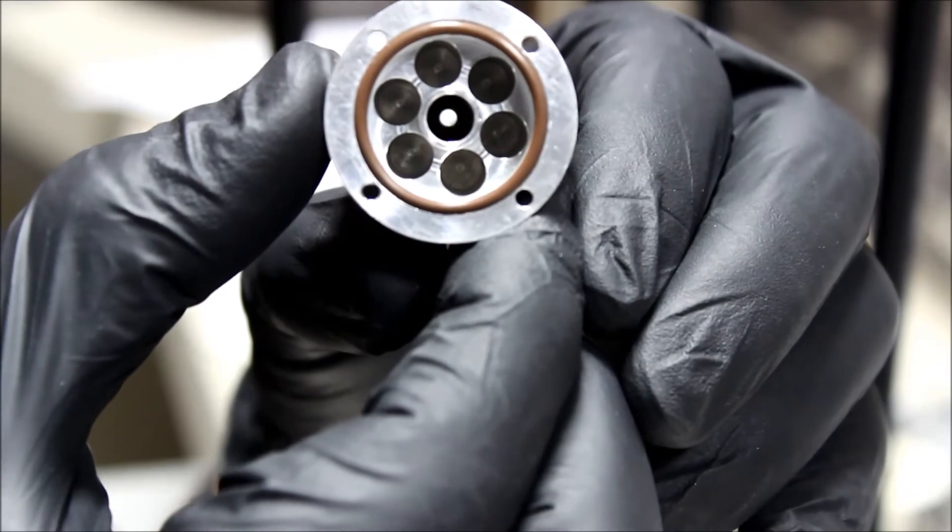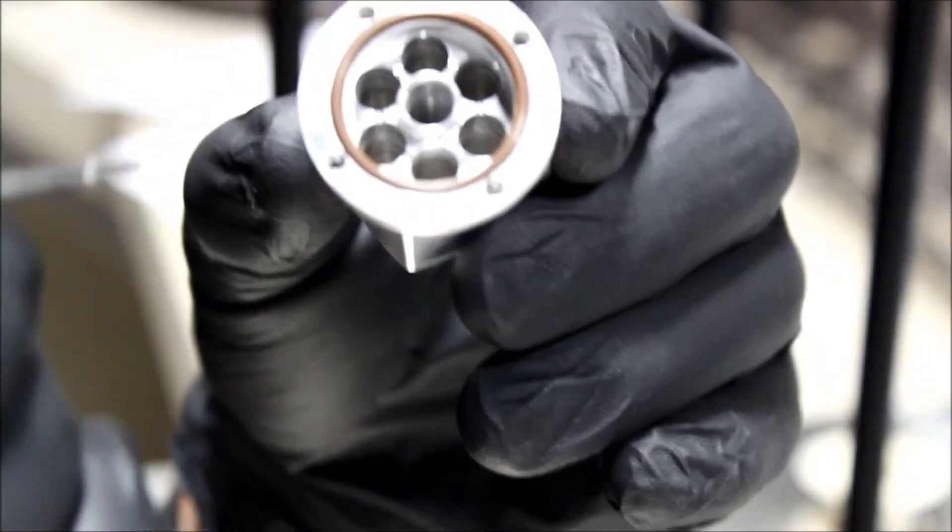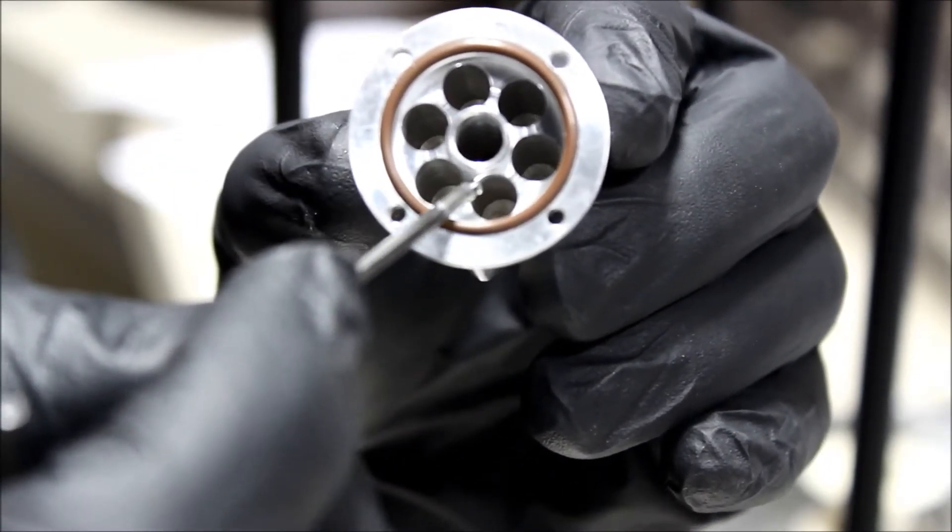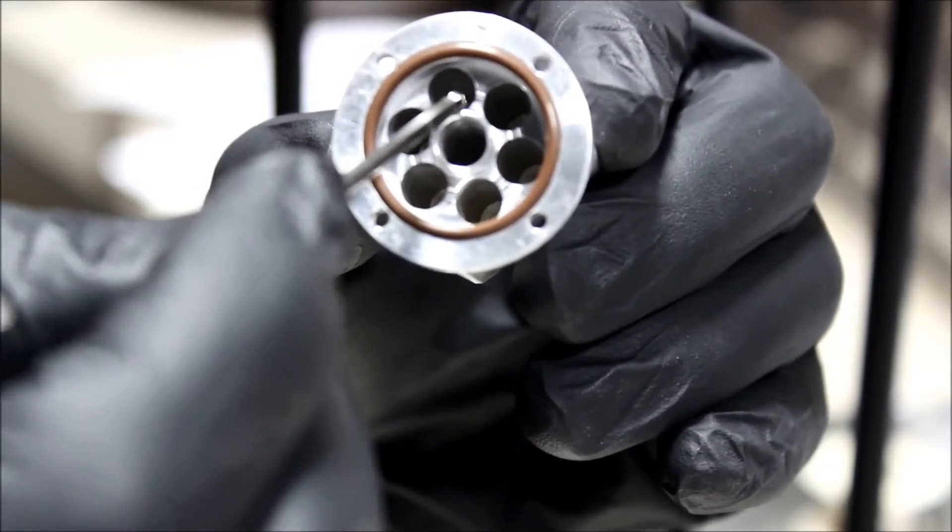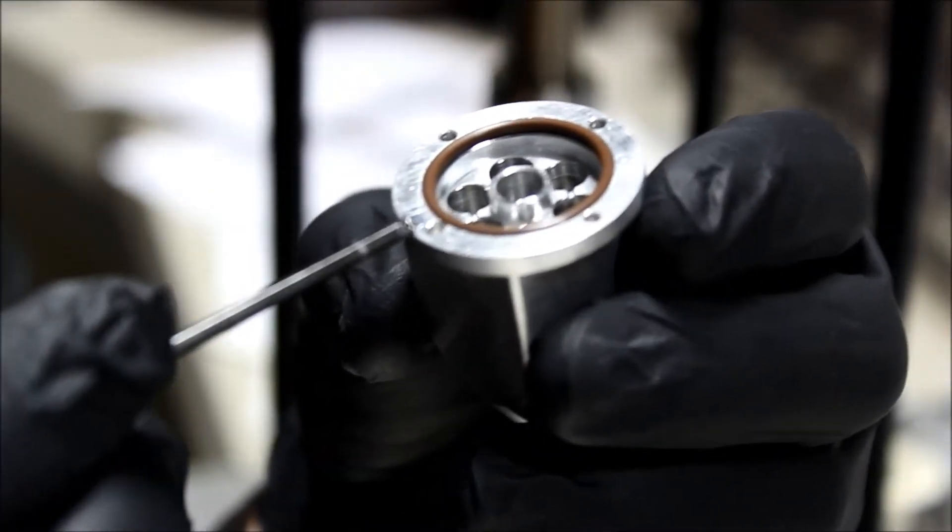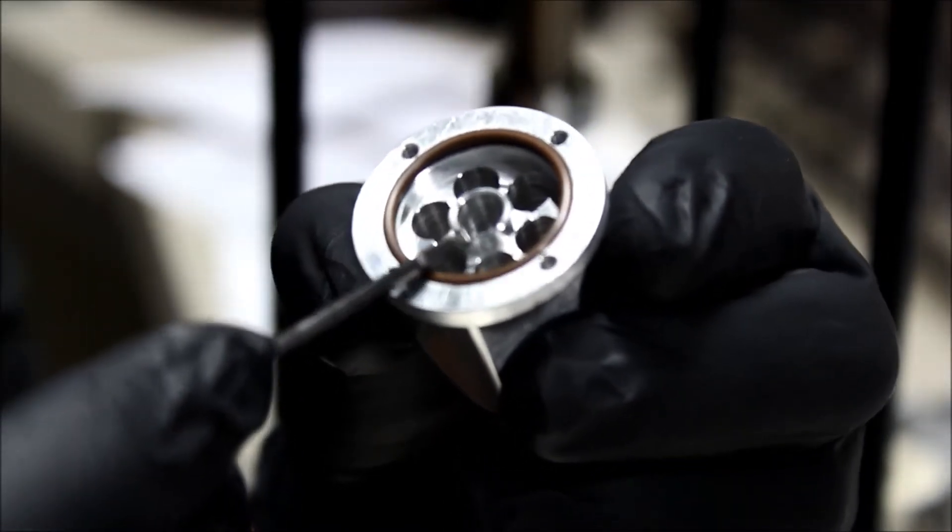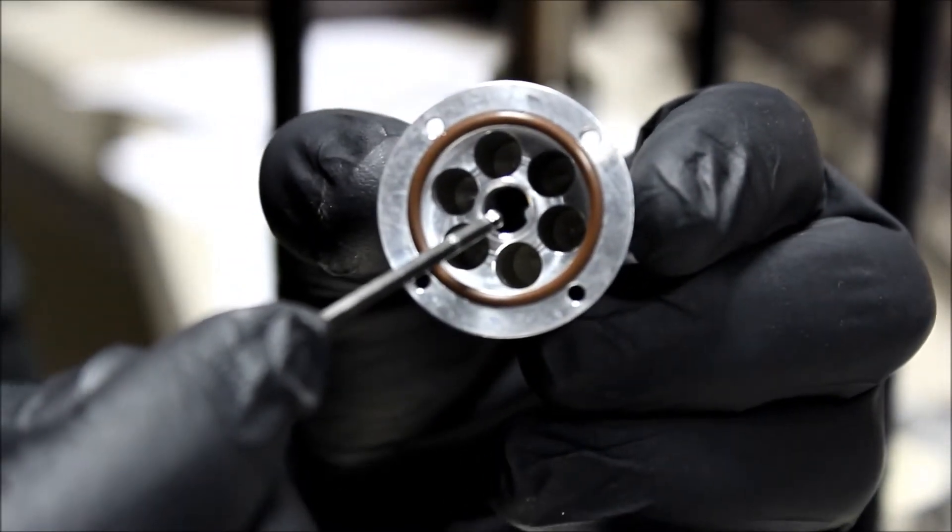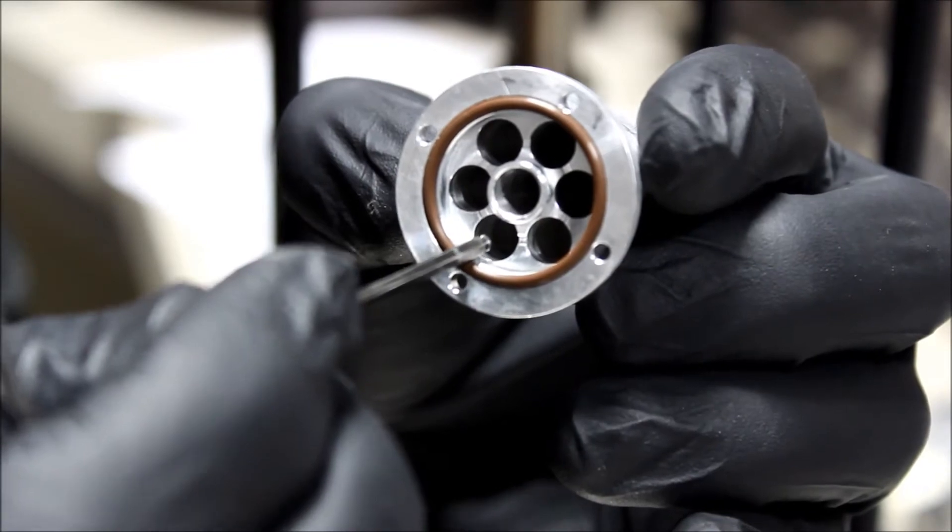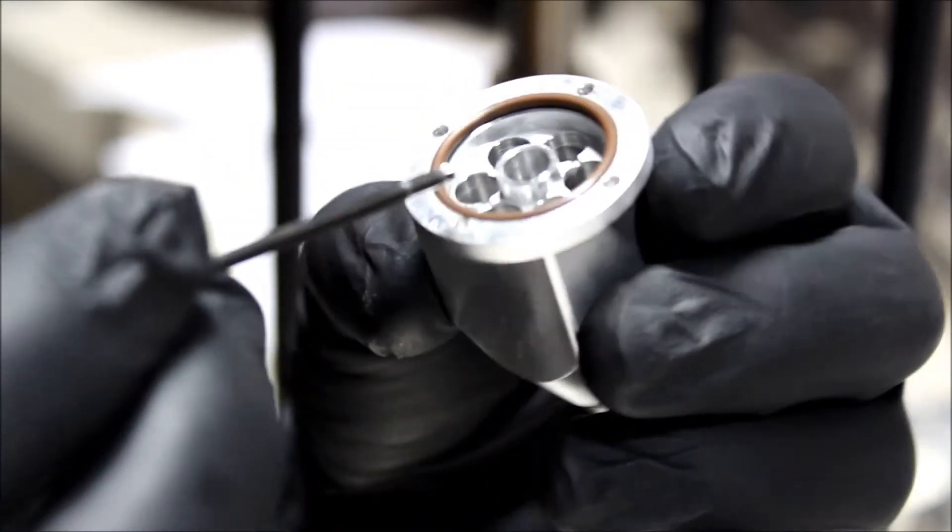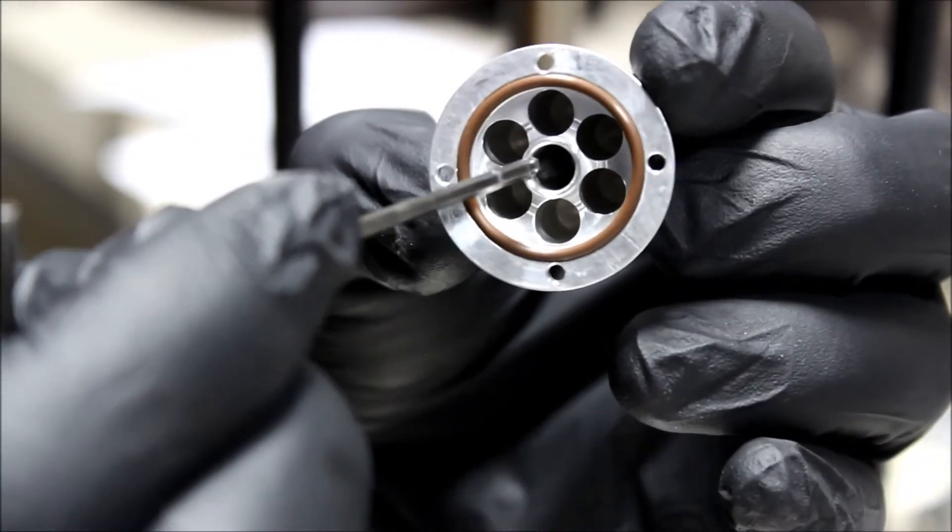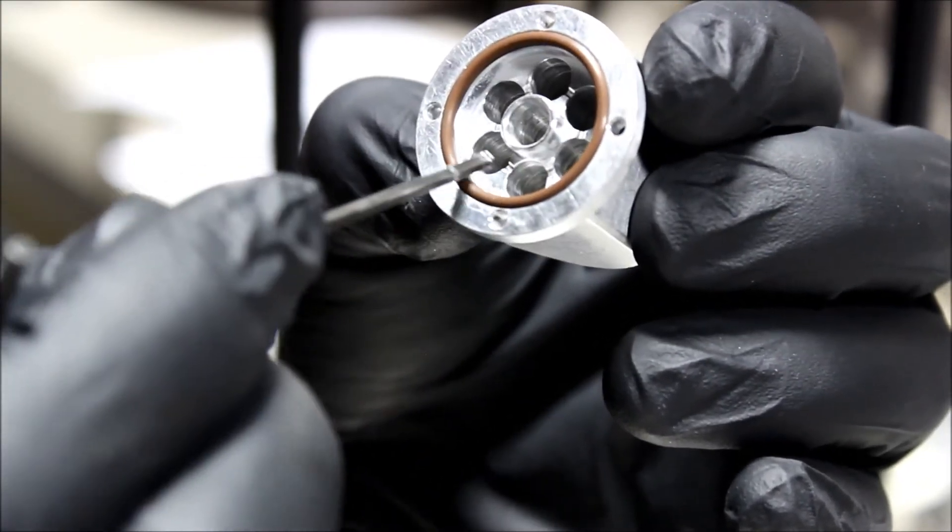The chemical occupies the space of these six perimeter bores in the interior of the crucible, and it's in these bores that we want to place our chemical. As you can see, you have to be careful not to contaminate this o-ring, and you do not want to get chemical in the center bore. So it's very important to be careful that you place chemical only in these perimeter bores. One thing you can do is place a little cork or a little rod—this is a quarter inch hole—you can place a quarter inch rod in the center and that'll keep material from falling in there.